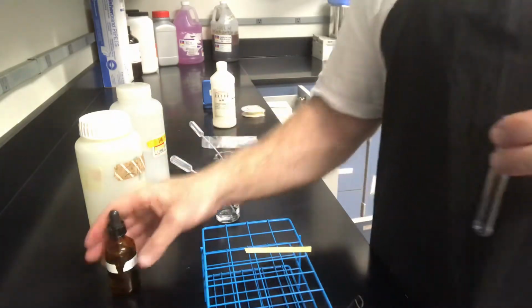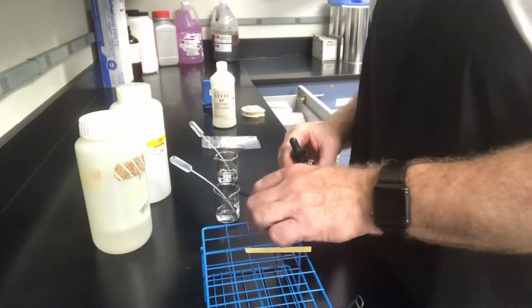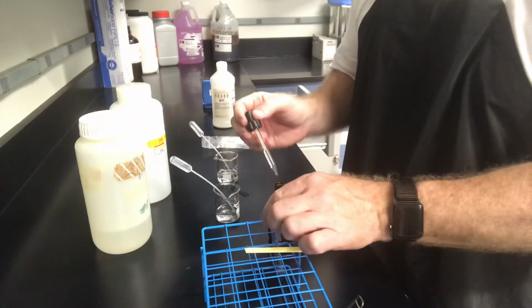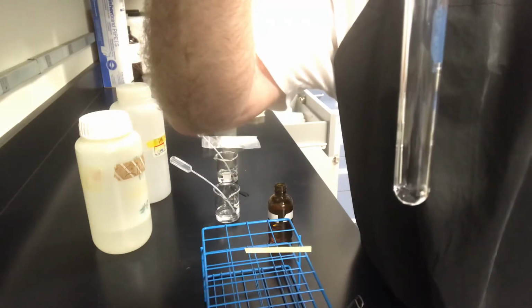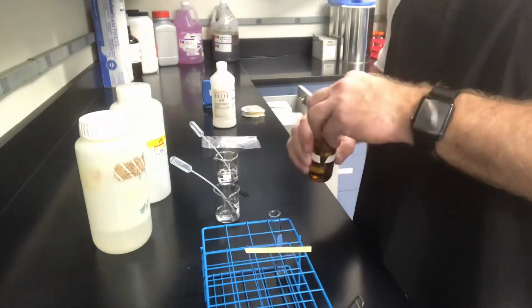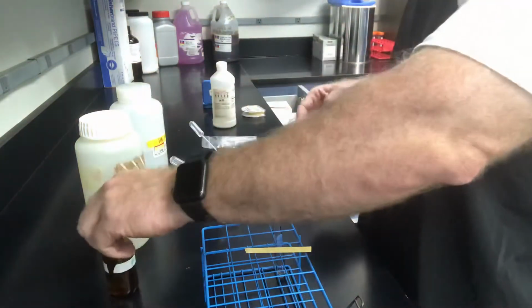I'm going to take the phenolphthalein. That's an indicator. Hopefully at this point you know something about phenolphthalein, and we'll put in 1 drop. We don't want to overdo it with this. I do want to make sure that it contacts the bottom of the test tube. It did. Sweet, well played. All right, let's cover this up. Now I've got to add the base, the sodium hydroxide, to it.